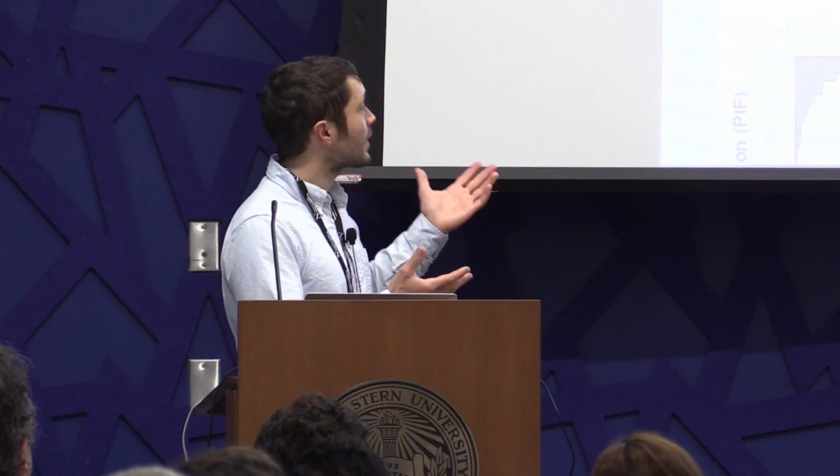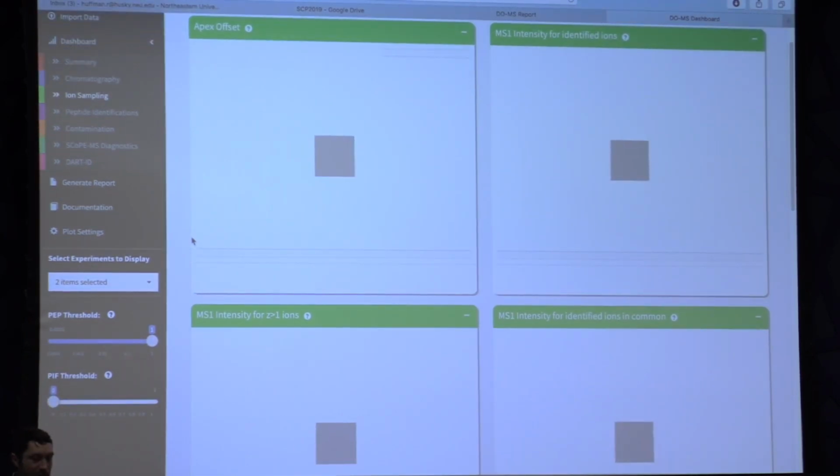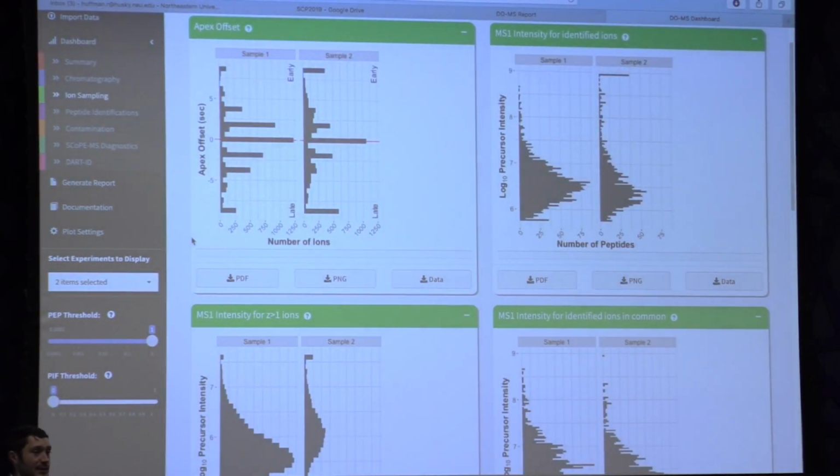And that's one of the strengths of this platform, is that it allows you to specifically diagnose issues. So in order to begin this process of diagnosing what may have happened, we can take a look at the MS1 precursor intensities for our ions, because perhaps we just injected less of the second replicate. But this doesn't seem to be the case. If we look at the top right-hand corner, we can see the MS1 intensity for all identified ions. And these two distributions are comparable. They may be off by a quarter of a log in terms of their mean.